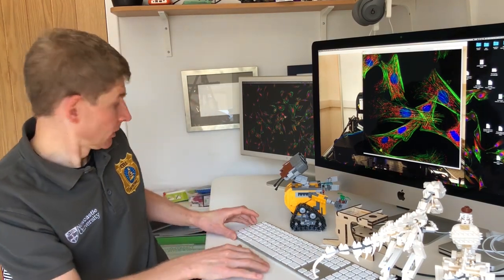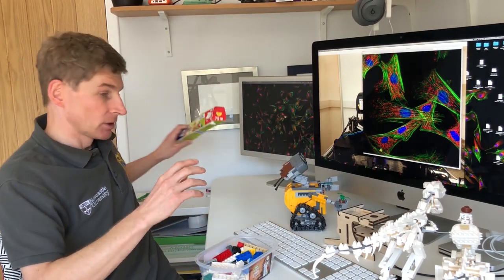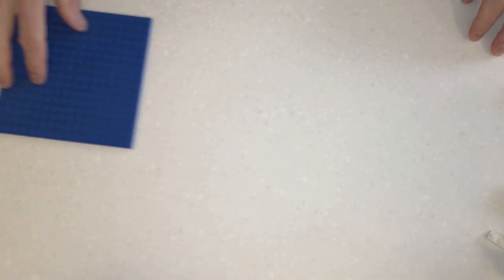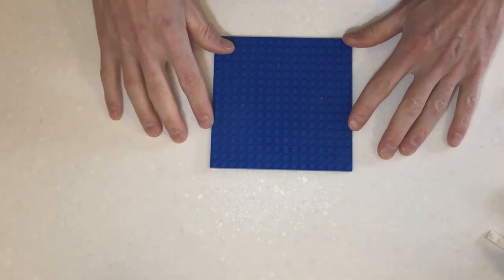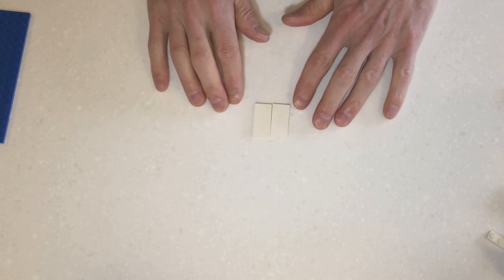So I've got some things with me here. We have some Lego and we have some cling film, and our lens is going to be formed from a droplet of water. First off, you're going to need a base plate. Something like this should be good enough. If you've got smaller or bigger bits of Lego that are flat, then that will be fine as well. We're going to need some Lego bits like this, preferably white if possible. These are going to form our stage of our microscope.